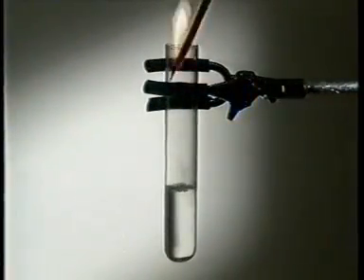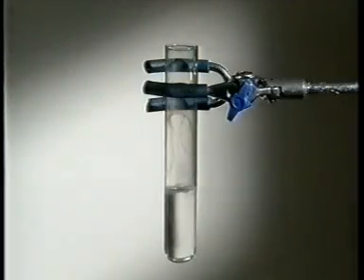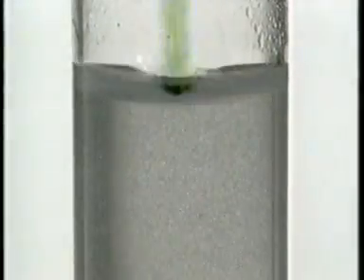So how does sodium react? Again it floats on the water and fizzes. The gas produced is hydrogen and the solution is alkaline.